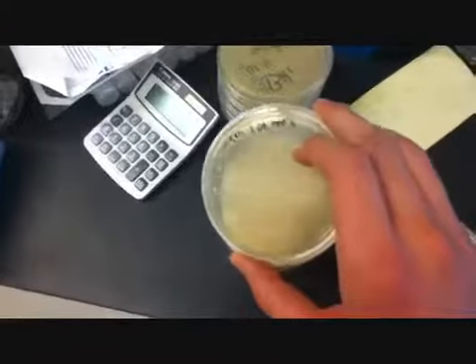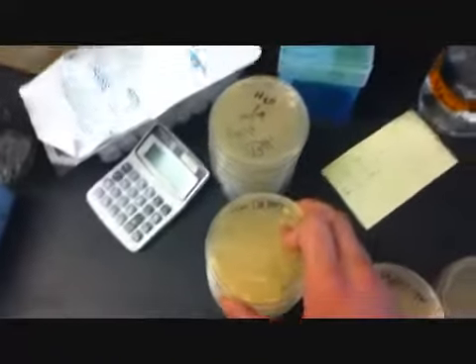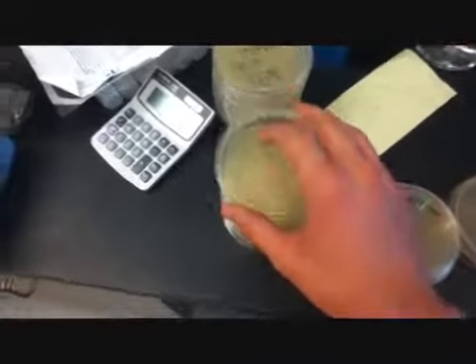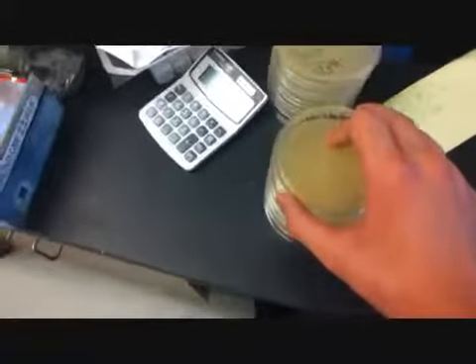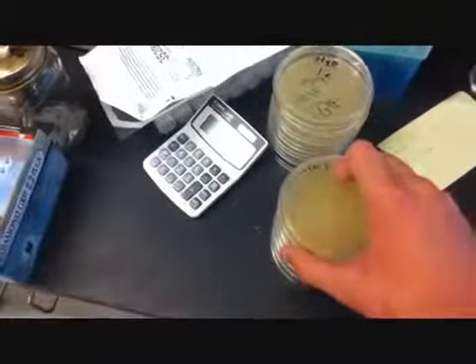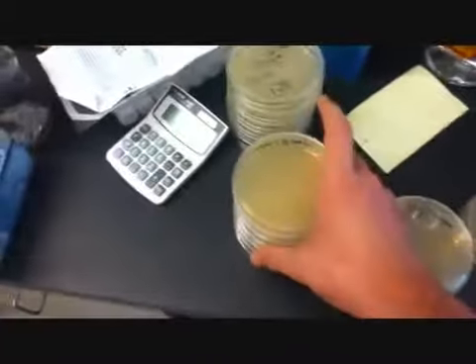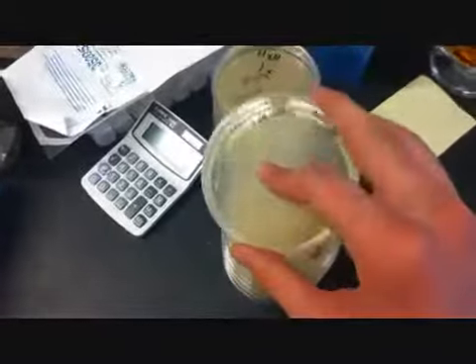And then this is the negative control. This is the bacteria that we put in the fridge yesterday, that we used to infect the other samples. These were not allowed to grow, but we made dilutions so we could compare them to the H2O, which appeared to have the most bacteria. It's not suspected that the H2O grew anything, but it is suspected that they're still alive, so maybe everything else here just killed it. Who knows? We'll see when we have the plates.